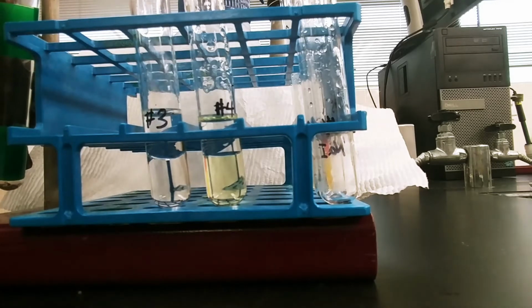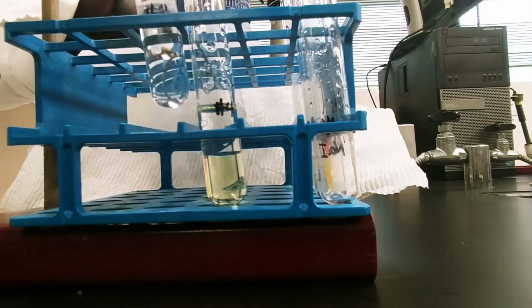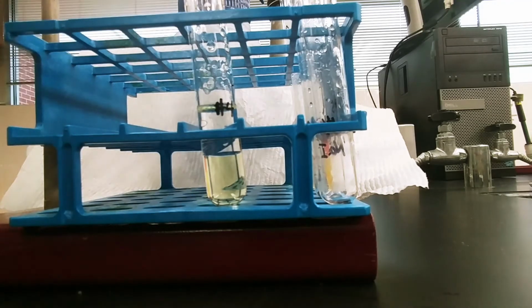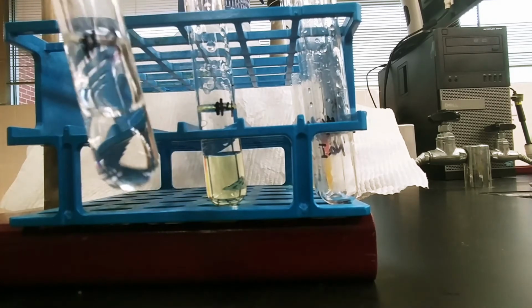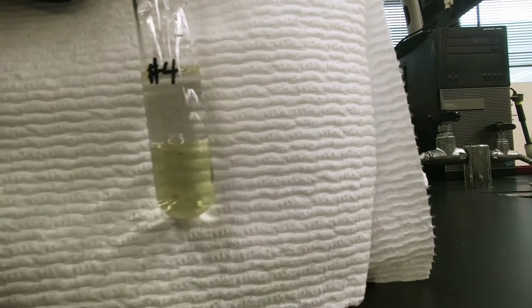We know from our background information and from the observations that we've just taken with the bromine that if bromine were present in this test tube, this cyclohexane would be turning bright orange, right? So if there was bromine present, we would be seeing an orange color. If there was iodine present, based off of the background information that we've been given, the top layer would be turning a pinkish purple.